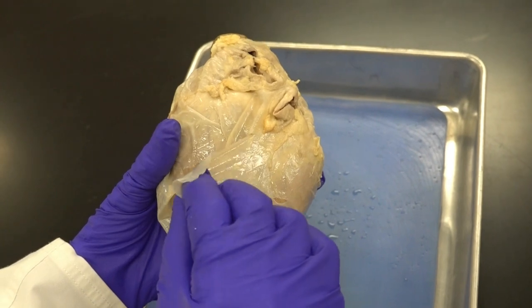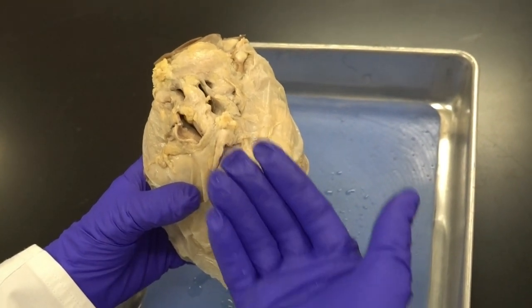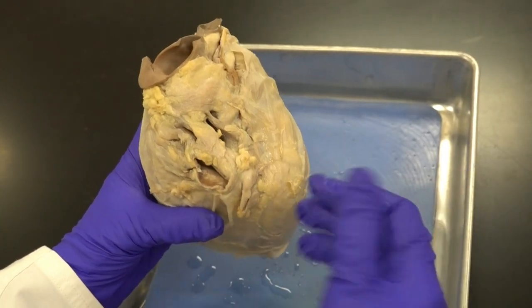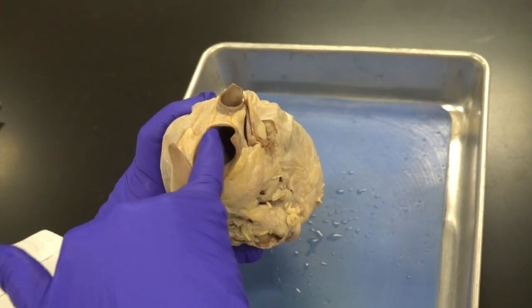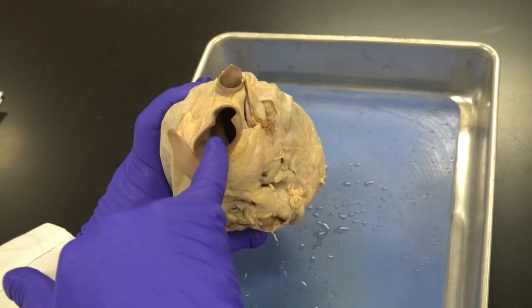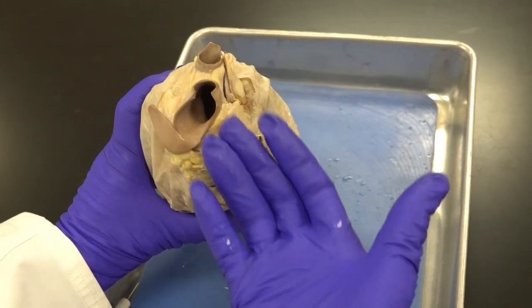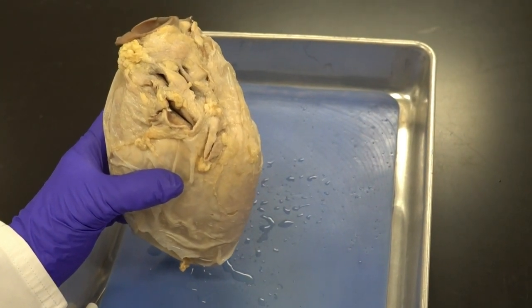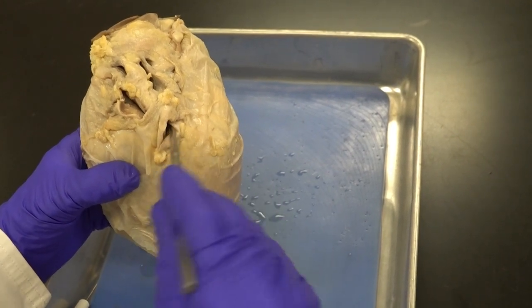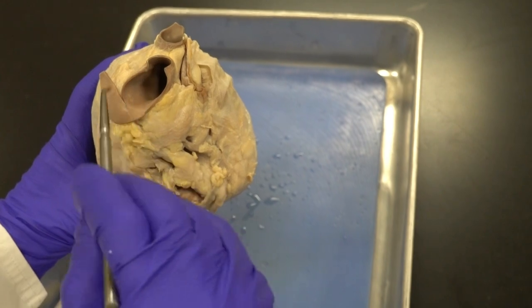Before removing the fibrous pericardium, note that it is attached to the connective tissues covering the blood vessels entering and exiting the heart. Some blood vessels have a wide open lumen because of their thick wall — even with no blood flowing, they stay open. These are arteries, which need thick walls to handle higher pressure. In contrast, veins have a very thin wall and collapse completely, as you can see here — I have to open the vein using my instrument.